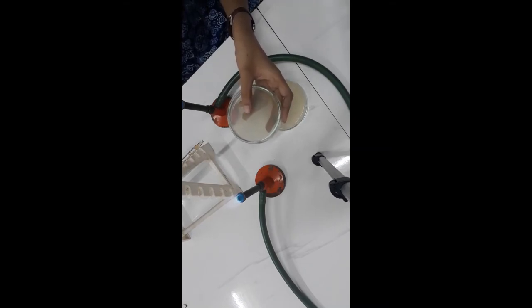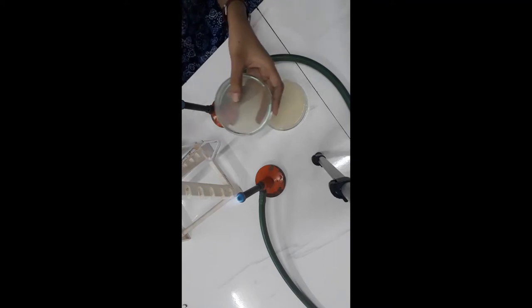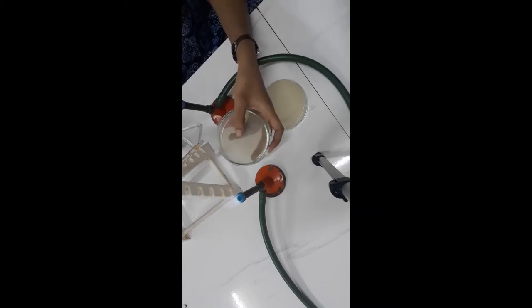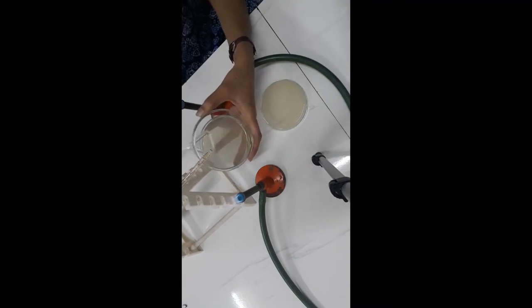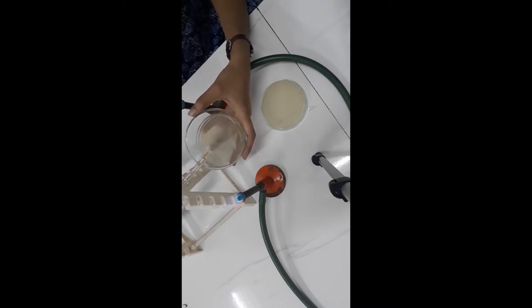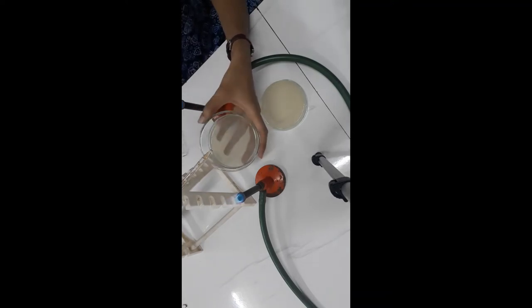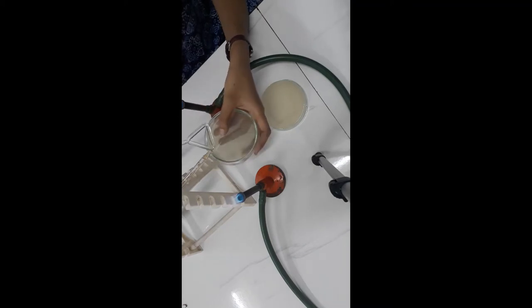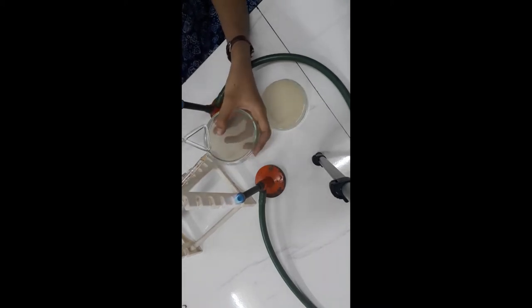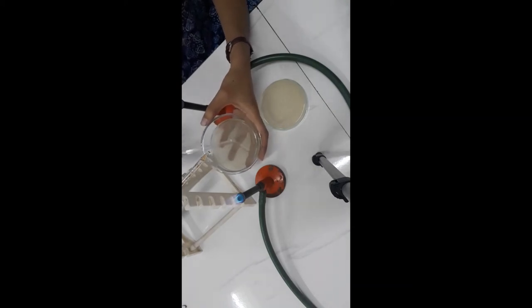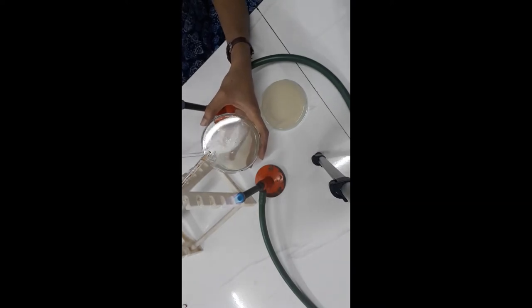The next step is spreading to be done by a sterile spreader. We dip the spreader in alcohol and flame sterilize it so that any organism present on the spreader will die and will not cause contamination. The spreading has to be done till the water gets absorbed onto the nutrient agar plate. Here we will be looking for overcrowding and any antibiotic producers that we are able to catch or find out.